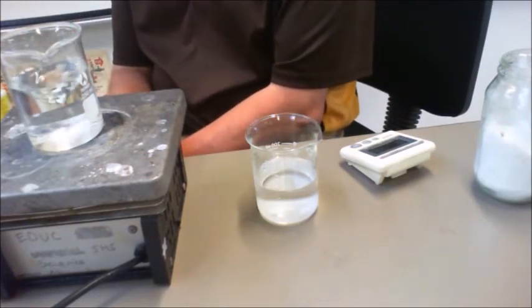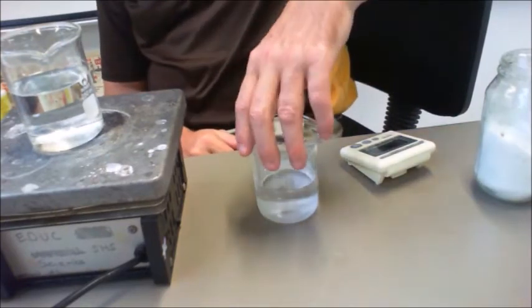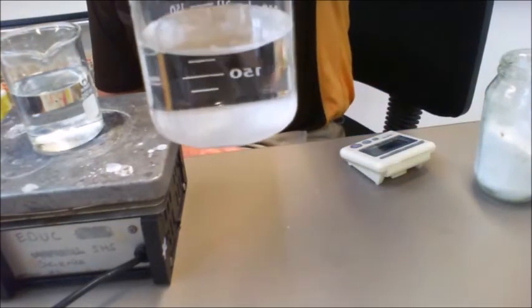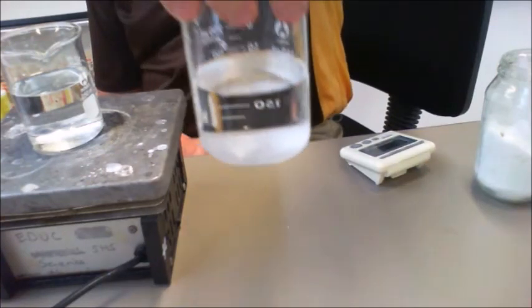It's the first one that has dissolved, and you can see there that it's basically got nothing left. However, with this one, you can see that the majority of the sugar is still present at the bottom of the beaker.